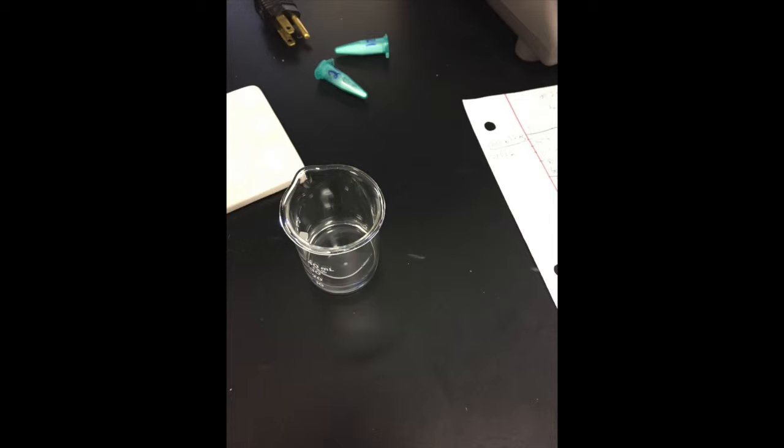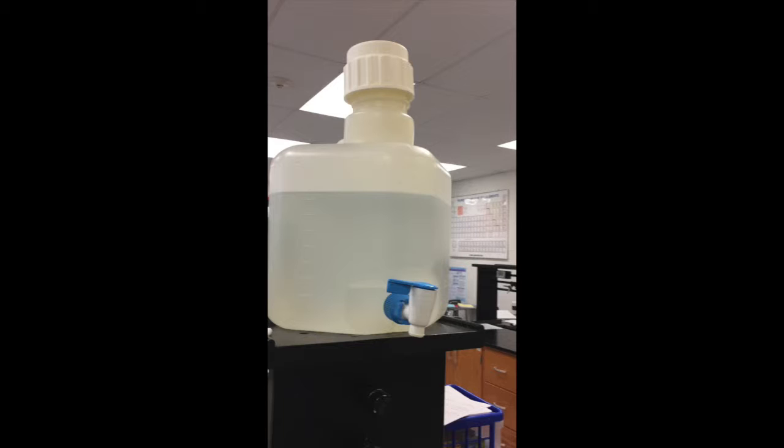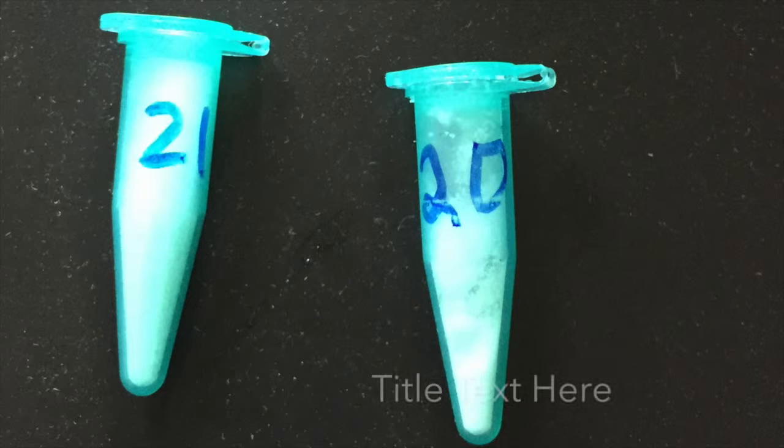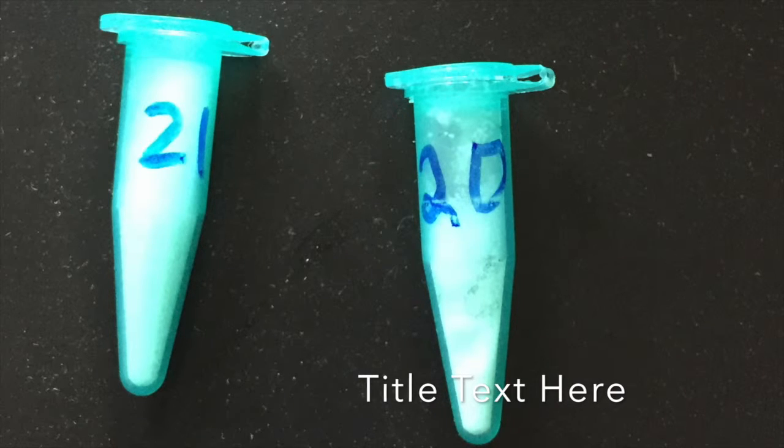Before we started our tests, we had to collect our materials. We collected 2 beakers, Q-tips, crucible tongs, a Bunsen burner, a striker. We used deionized distilled water, and we also used a spoon. After the material collection was complete, we started the lab.